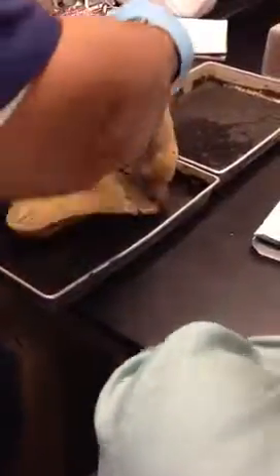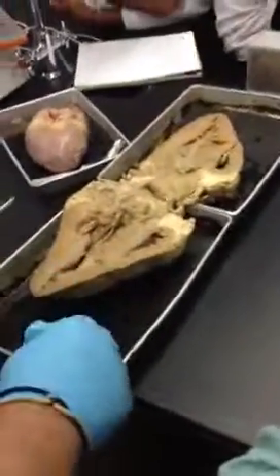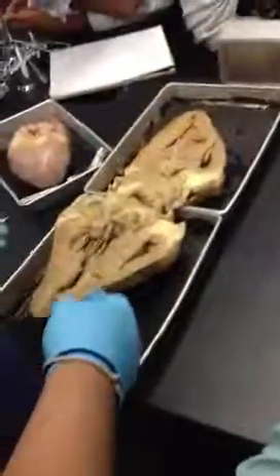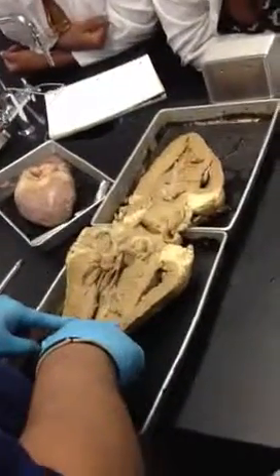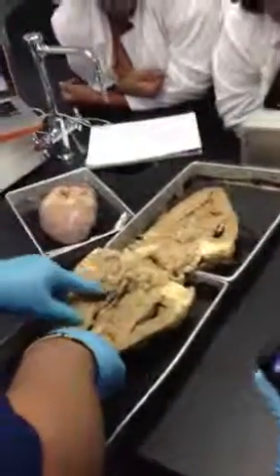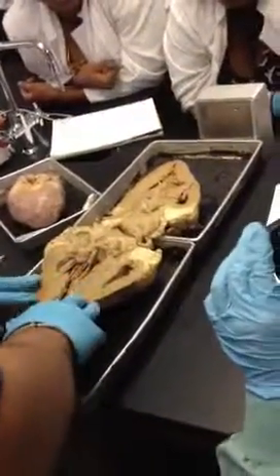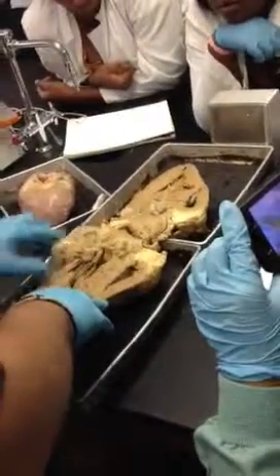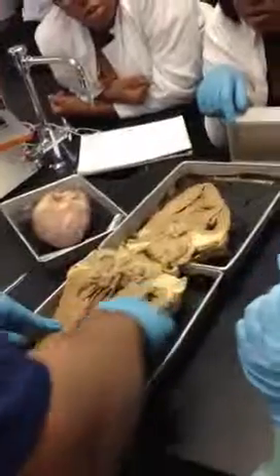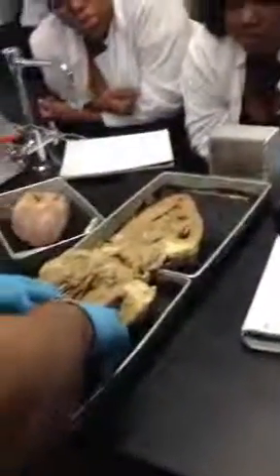All right, so I'm going to flip it over like that. Okay, so now we can actually see the inside of the heart. Notice the difference in the amount of muscle mass on the sides of the walls of the ventricles. Notice that this one's much larger than this one over here. This tells us the difference between the left and right ventricles. The left ventricle has more muscle mass than the right ventricle. So this is the left ventricle, this is the right ventricle. Okay? Y'all good so far?